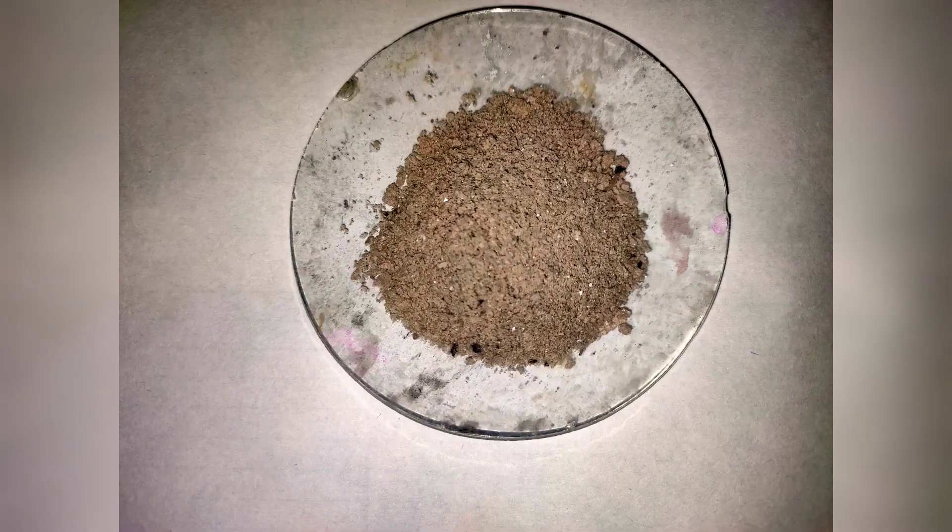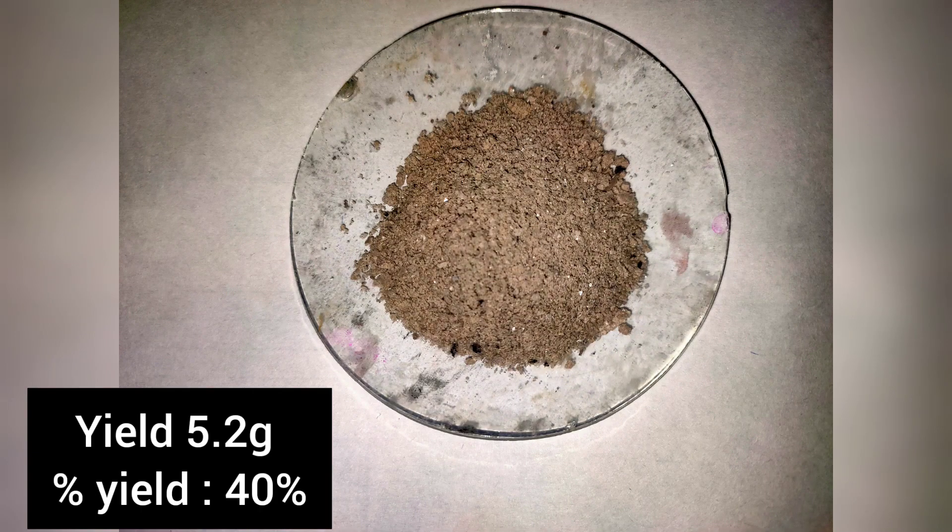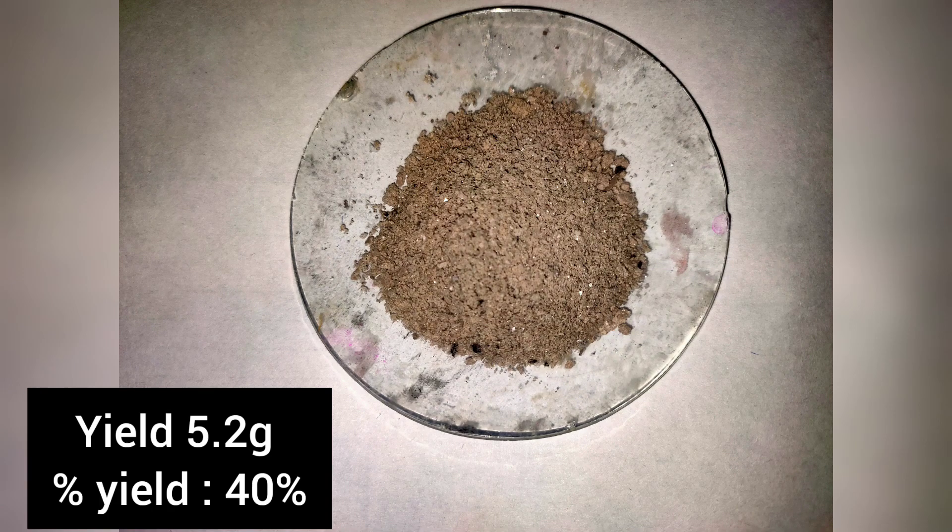I dried them in my desiccator and they weighed around 5.2 grams, which corresponds to a percentage yield of 40%.